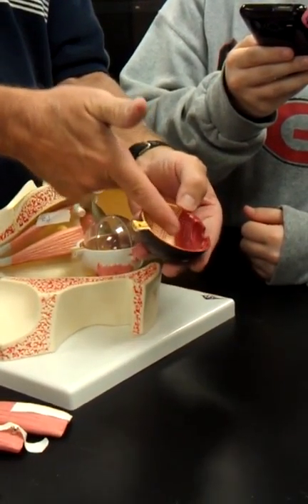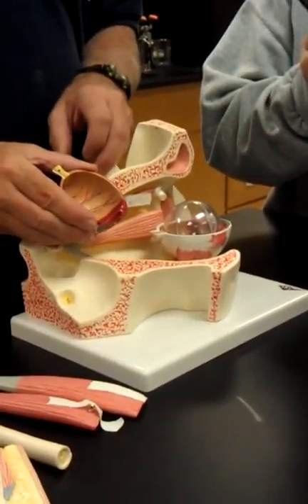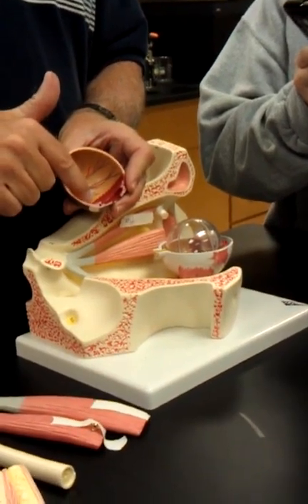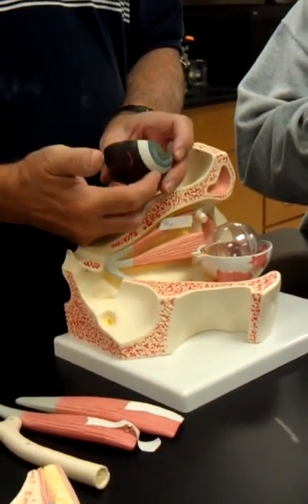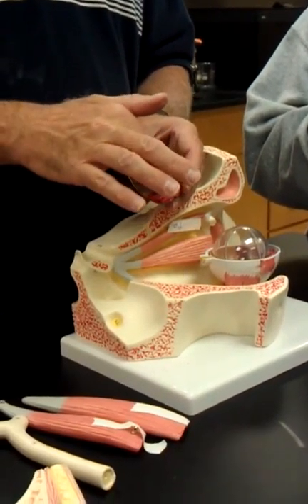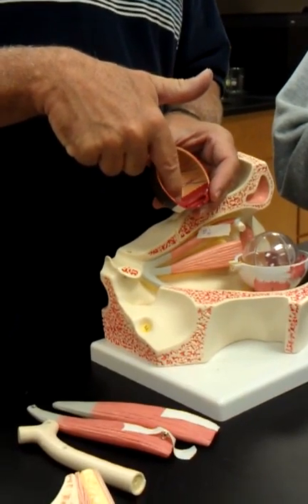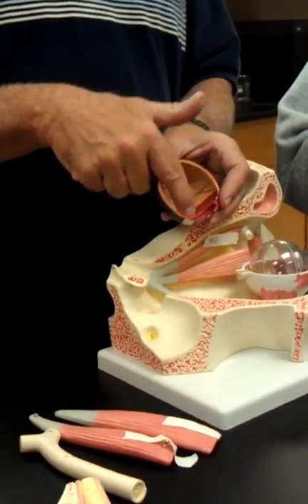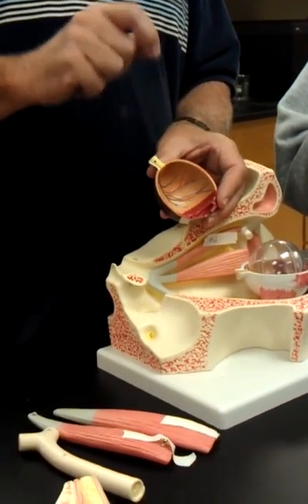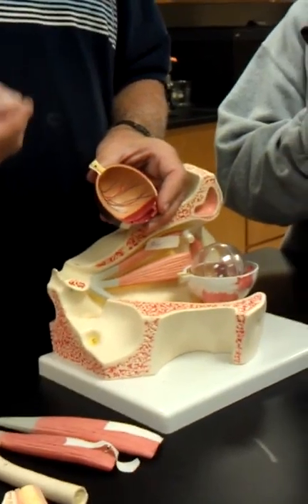Instead, it comes right here at that scallop border, which is called the ora serrata, and that's where the retina meets the ciliary body. So the ciliary body is white in color here, but it's reddish on this side. And these silver streaks that you see right there in the ciliary body are the ciliary processes of the ciliary body that contain capillaries that secrete the aqueous humor into the anterior segment.